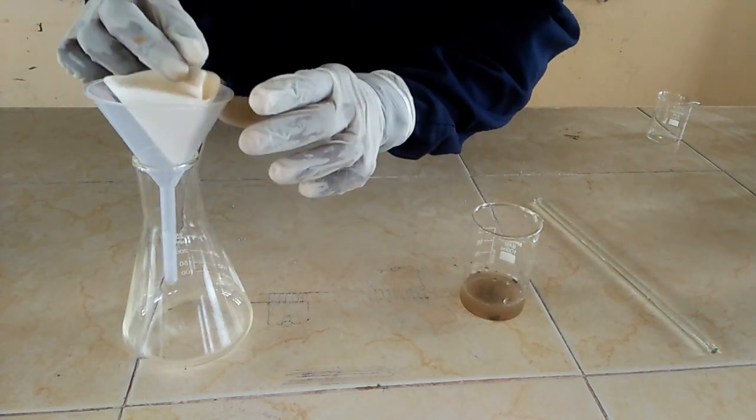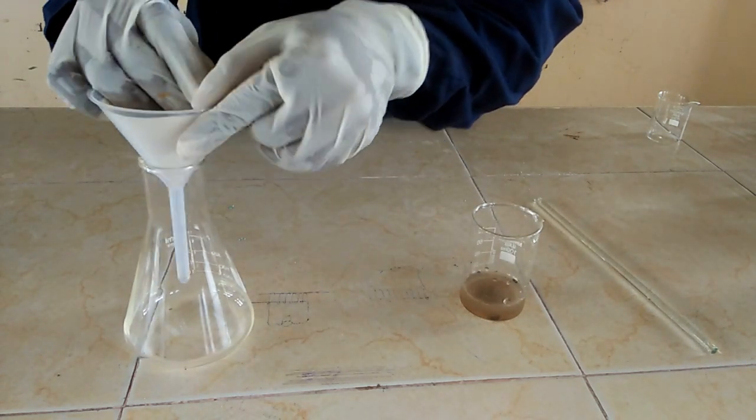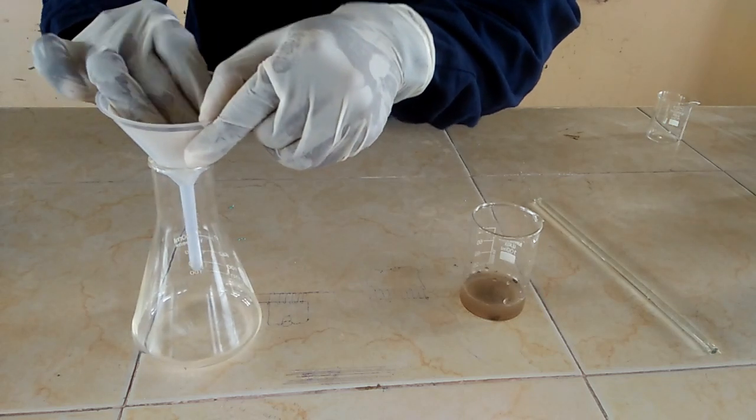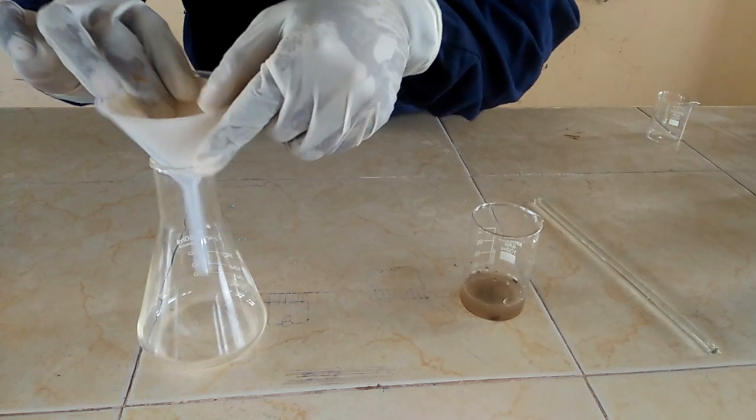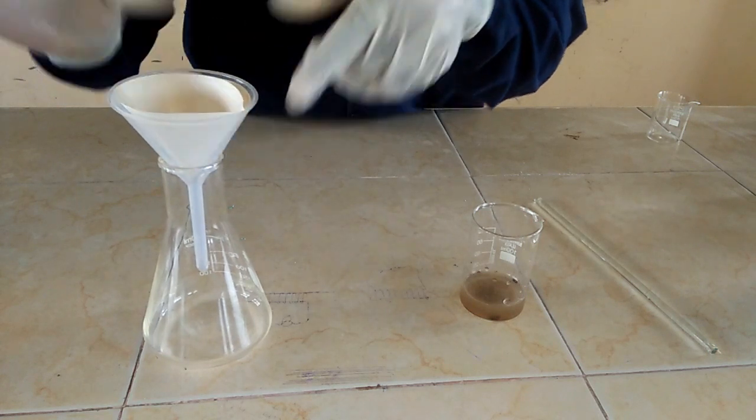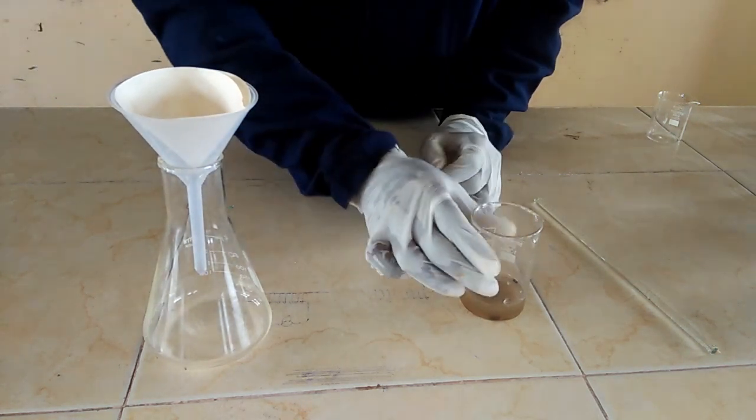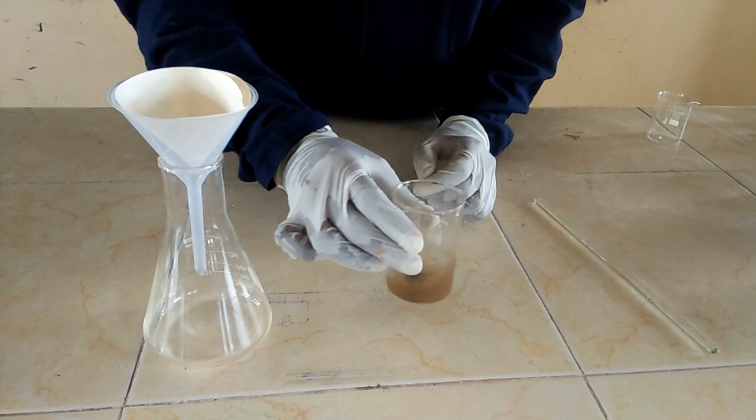So I have my cone, very good cone. Then I am going to place the cone in a filter funnel. Make sure it fits well. Good.